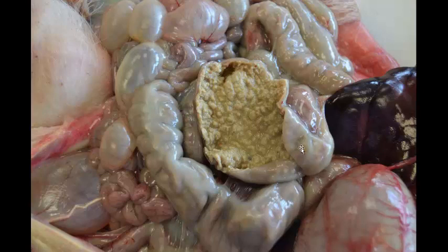I don't think it looks too much like it, but some people say that it looks like a Turkish towel, which I think is just a regular old bath towel. The appearance looks like a Turkish towel, but the yellowish green color lets you know that there is necrosis. There is what used to be called a diphtheritic membrane, and necrotic mucosa often turns sort of a yellow-green here.